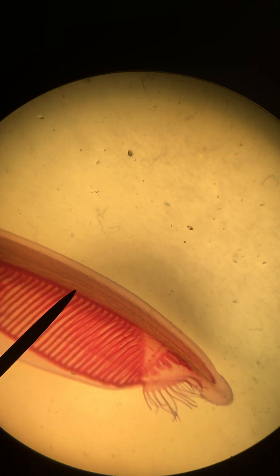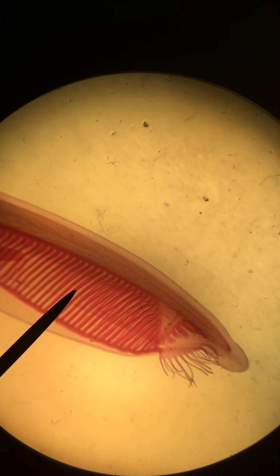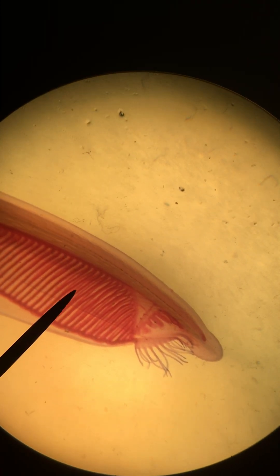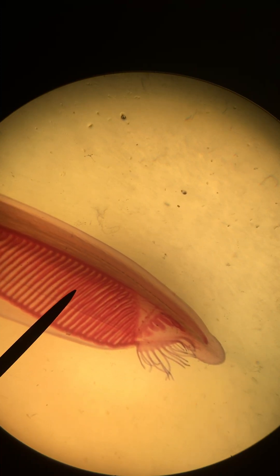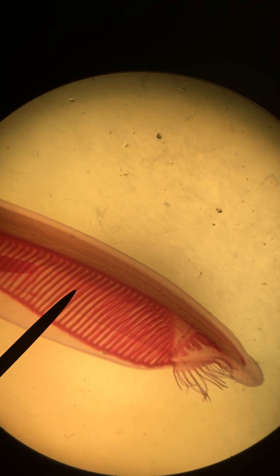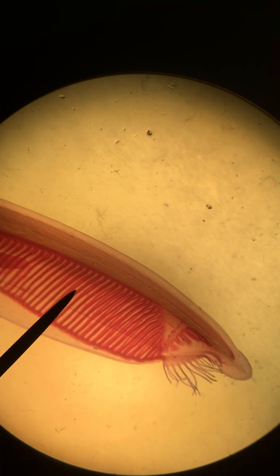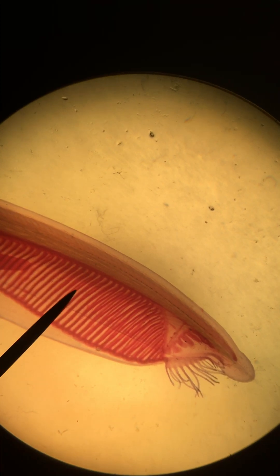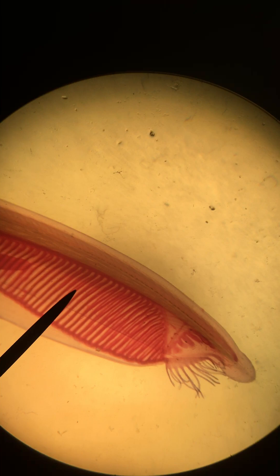If we move just ventral to the notochord, all of these things here are the pharyngeal gill slits and bars. The slits are the pale sections and the bars are the pigmented tissue there.